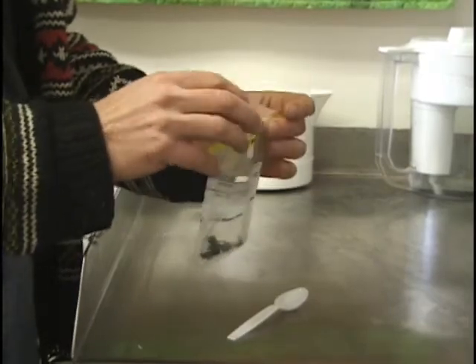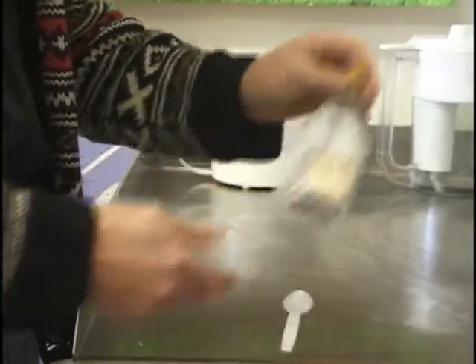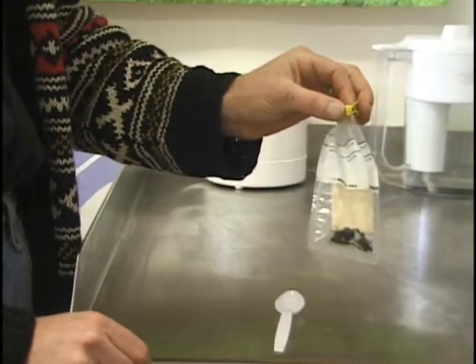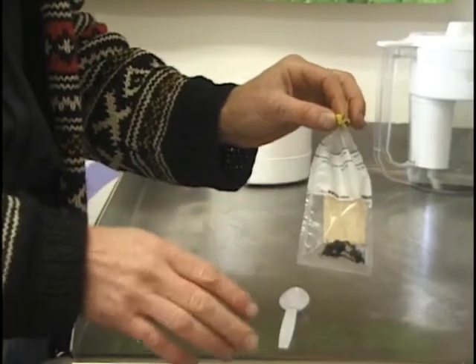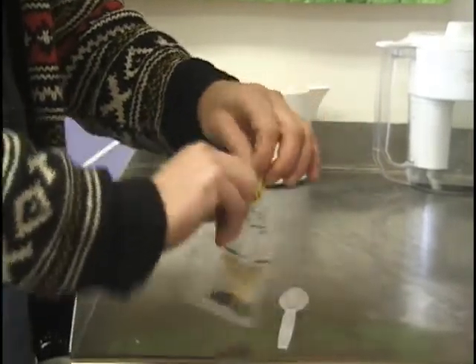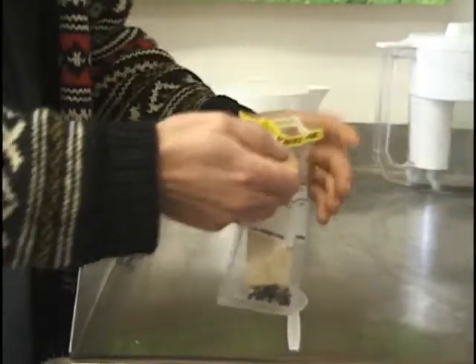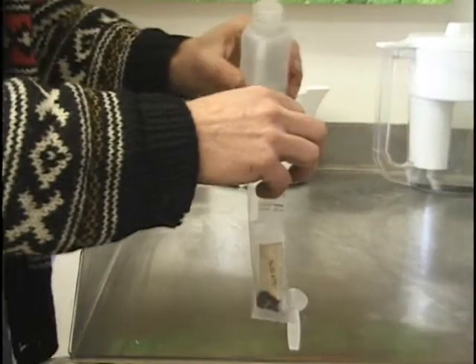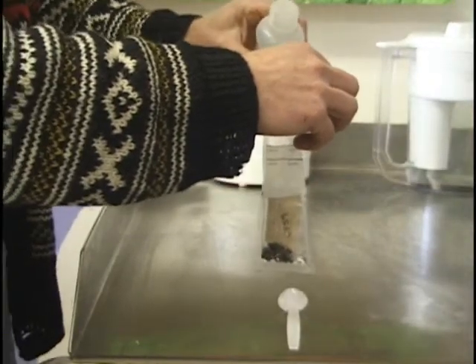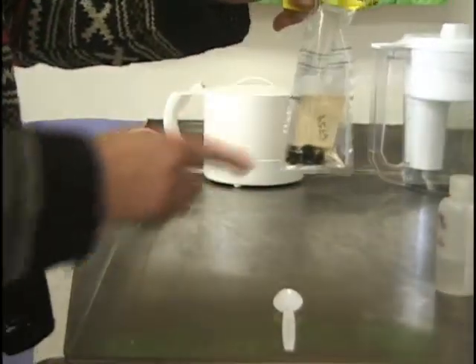You add the label in pencil and drop it into the whirlpack. When I'm in the field, I just fold the whirlpack over one time and do a quick twist. I add the alcohol later when I'm back in the lab, because it takes too much time and is too much of a bother to carry alcohol in the field. When I'm back in the lab, I open it back up and add alcohol — just enough to cover the specimens, not a large amount.